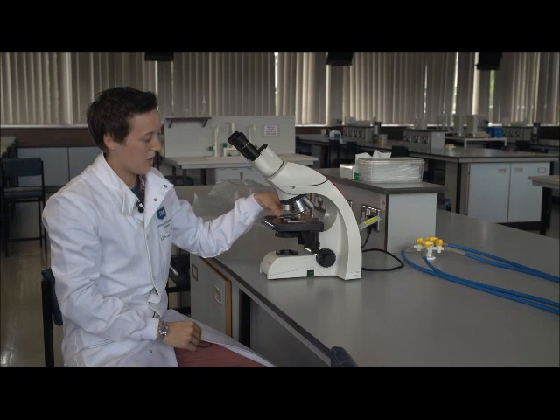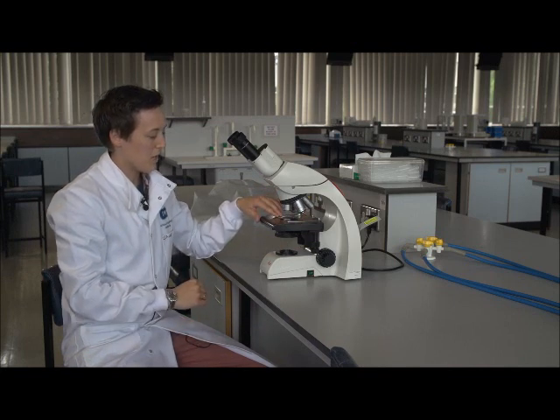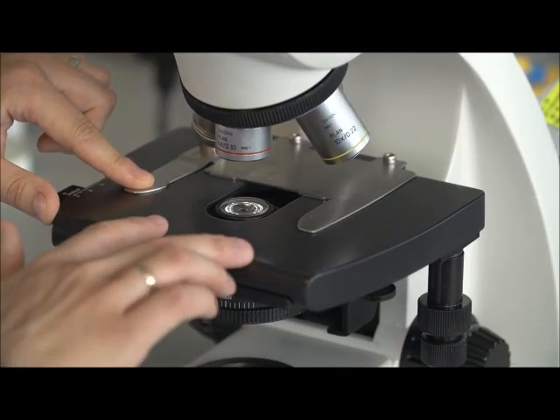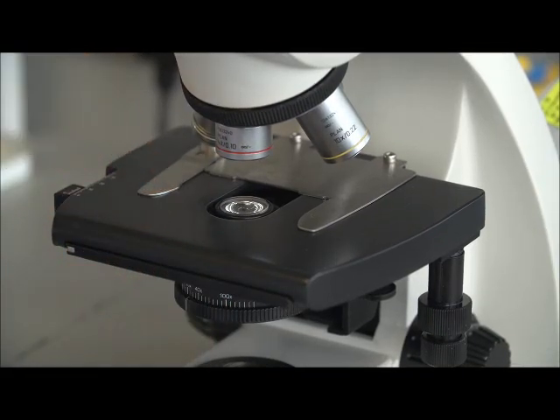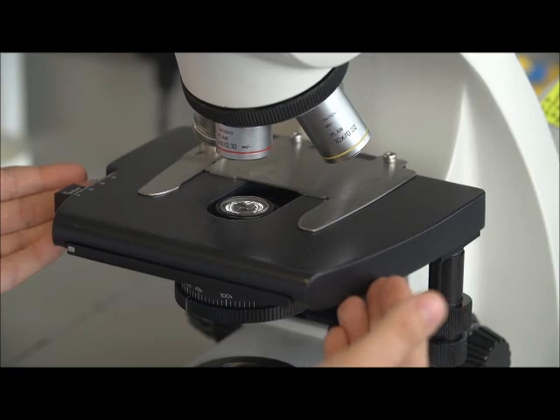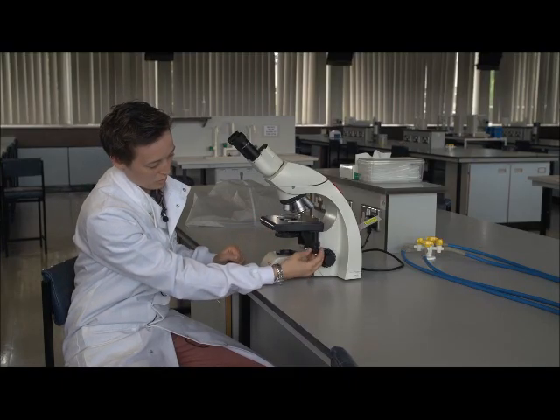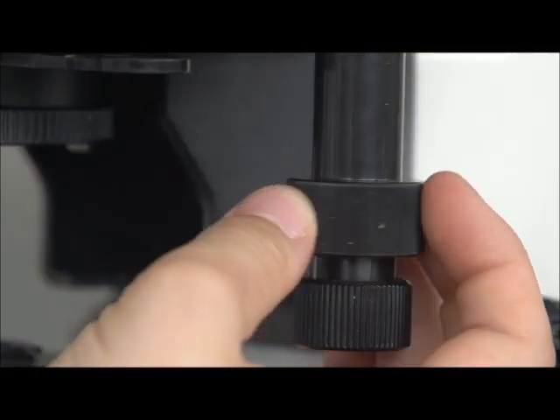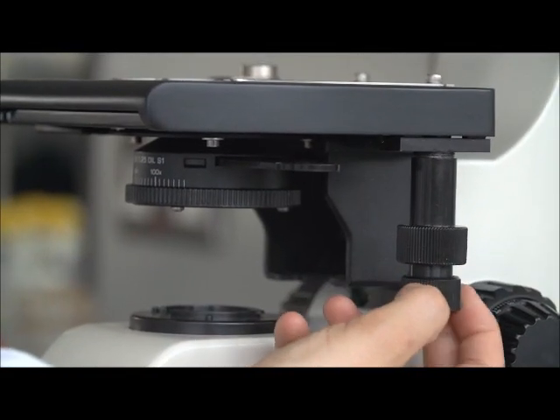Next we have the slide holder. When we need to put a slide in, we just pull back on the slide holder there, push the slide in and let it grip the slide. We then have the stage. Now the stage movement is controlled by an XY controller here on the side, to be able to move your specimen and slide.